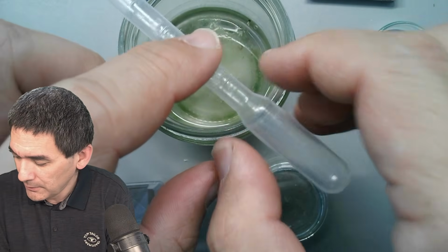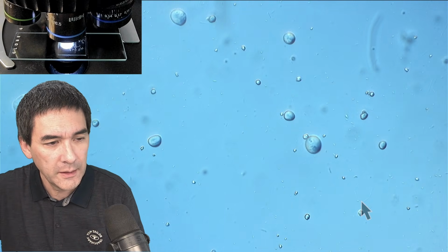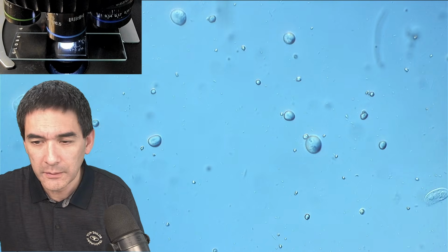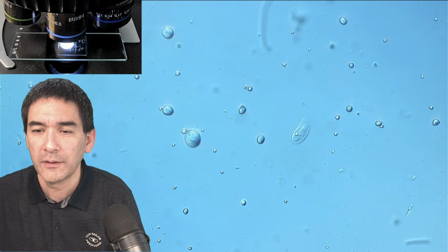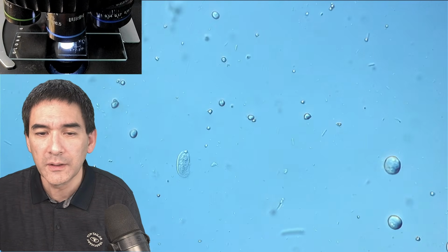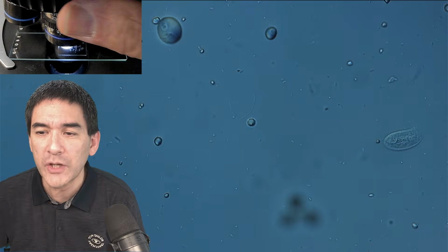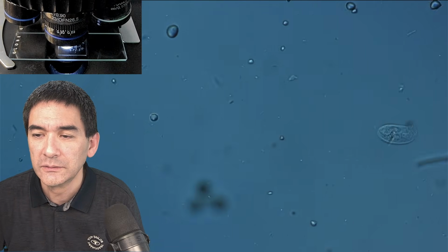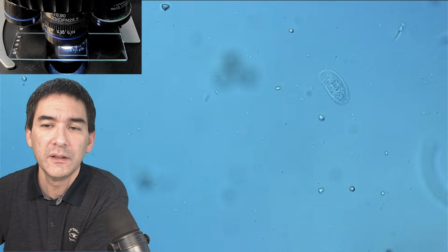Okay. So let's quickly have a look back here as a last little look. Let's remove the arrow. So you see now they're actually much better visible. Maybe a last high magnification view with my 60 times objective of this cell over here. Where is it? Here it is. It's too dark still. And here we go.